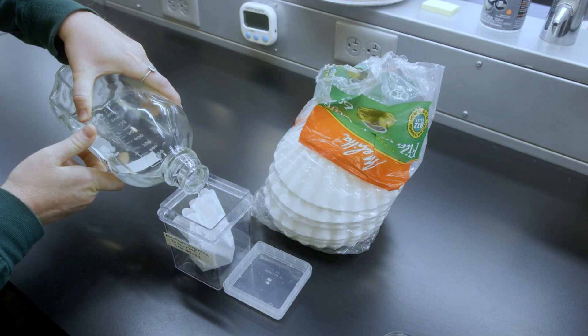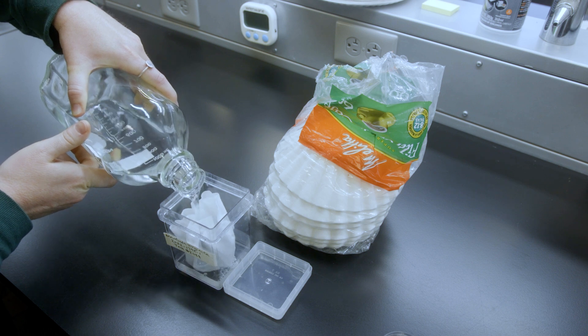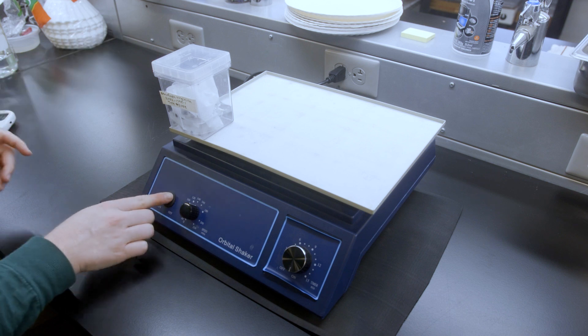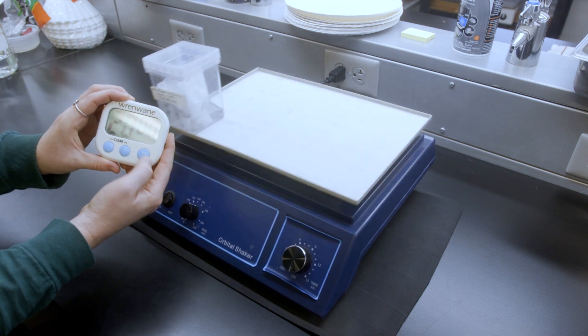To disinfect, I place the seeds into coffee filters and pour the solution until it covers the seeds. The container is then placed onto an orbital shaker for 20 minutes.